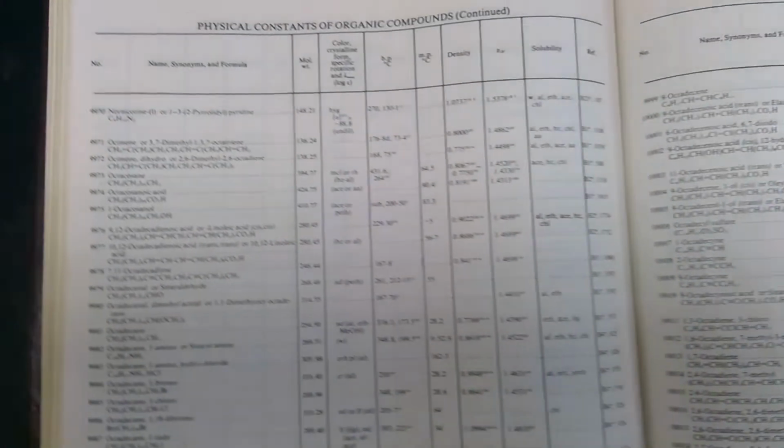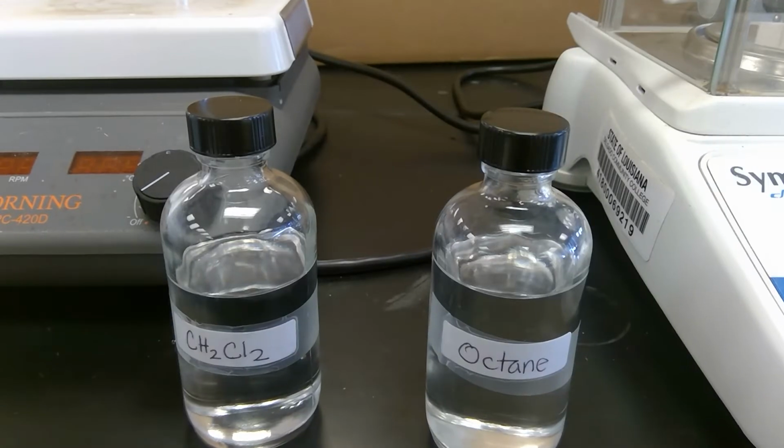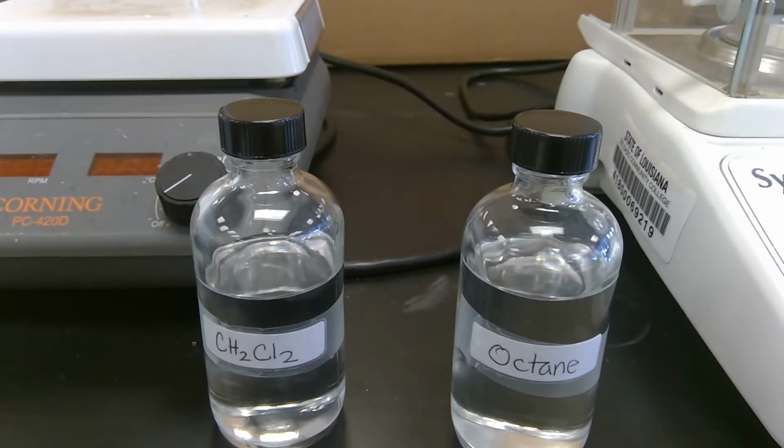So initially when we plugged in the LabQuest, you'll notice that we have that initial temperature, which was 23 point something. I believe it was 23.1. But you can look at that temperature at the very beginning of the experiment where we did the melting point.